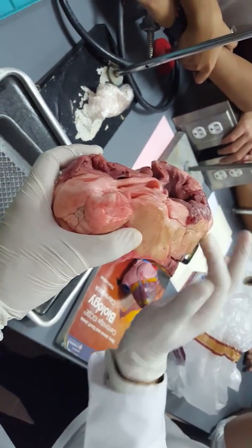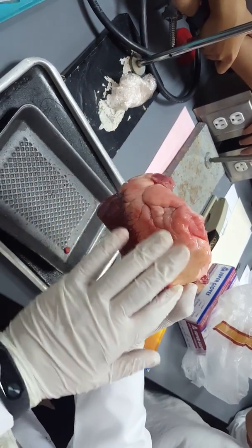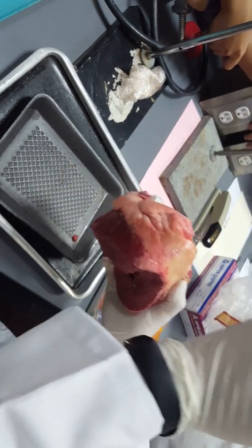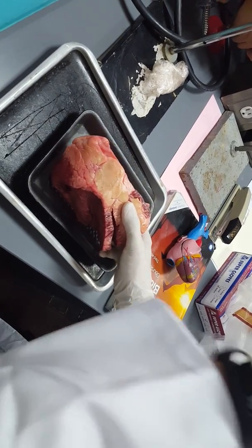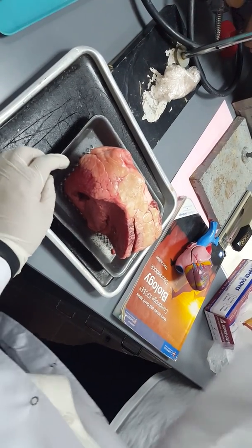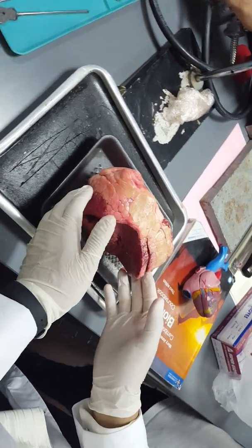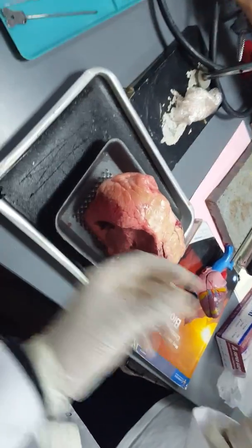And here you can see very obviously a fat layer. Who can tell me the purpose of this fat layer? Because it produces more energy. Providing energy for the heart muscle, because we discussed before in chapter 2, Chemicals of Life, that 1 gram of fat gives you more than 1 gram of carbohydrate plus 1 gram of protein together. So we need this energy for the heart muscle to perform its function.